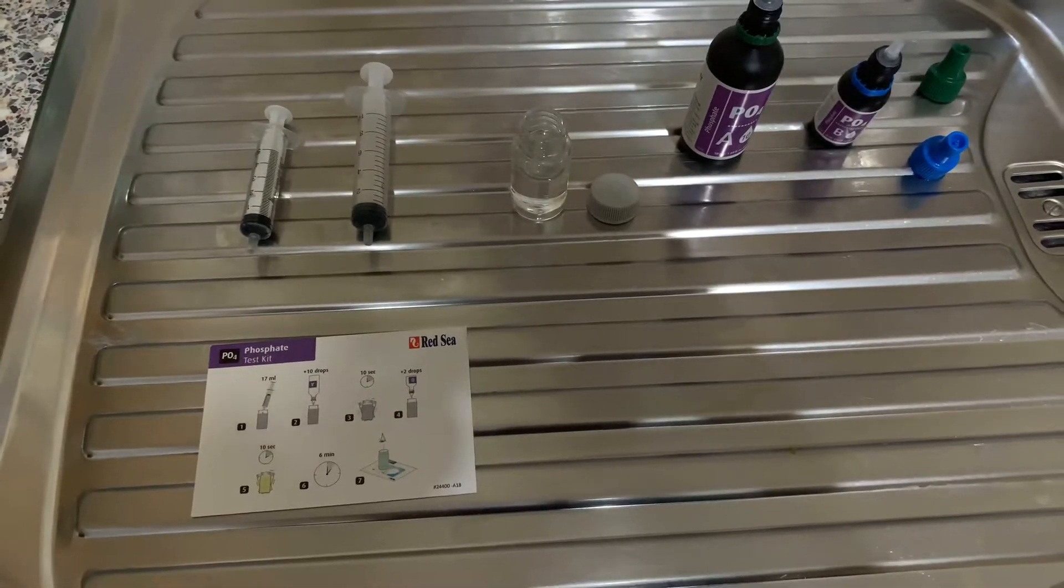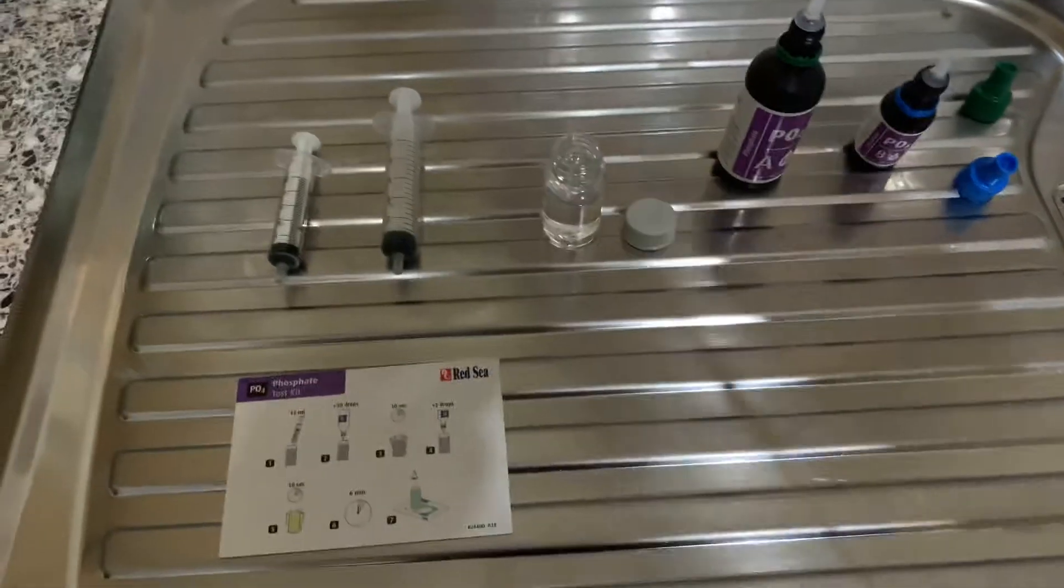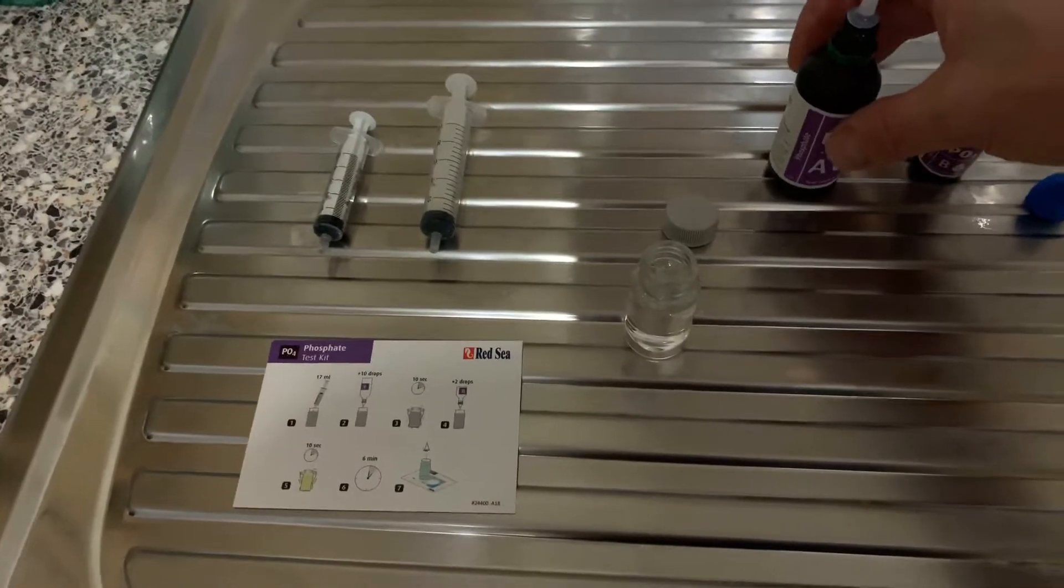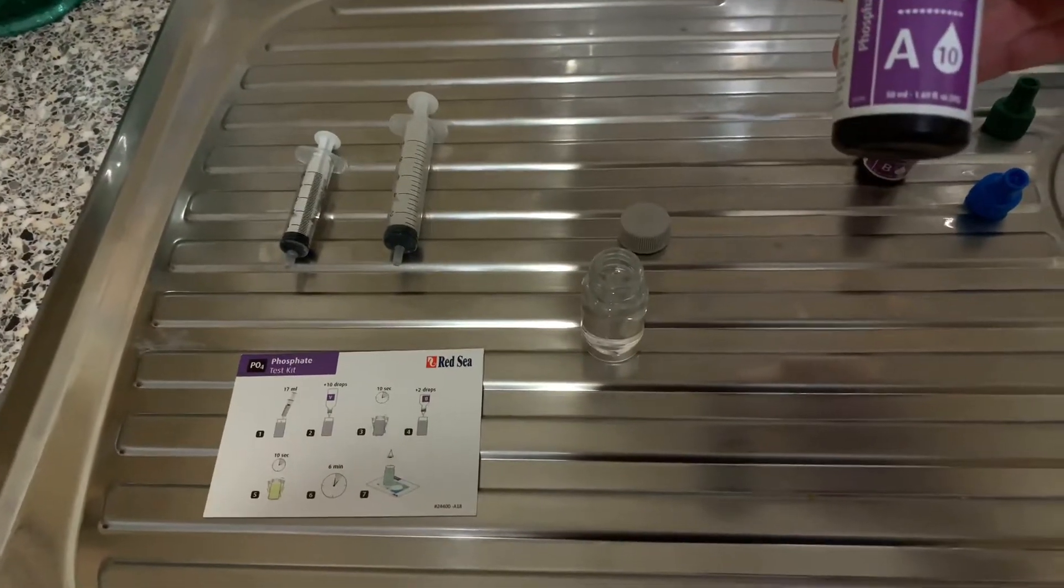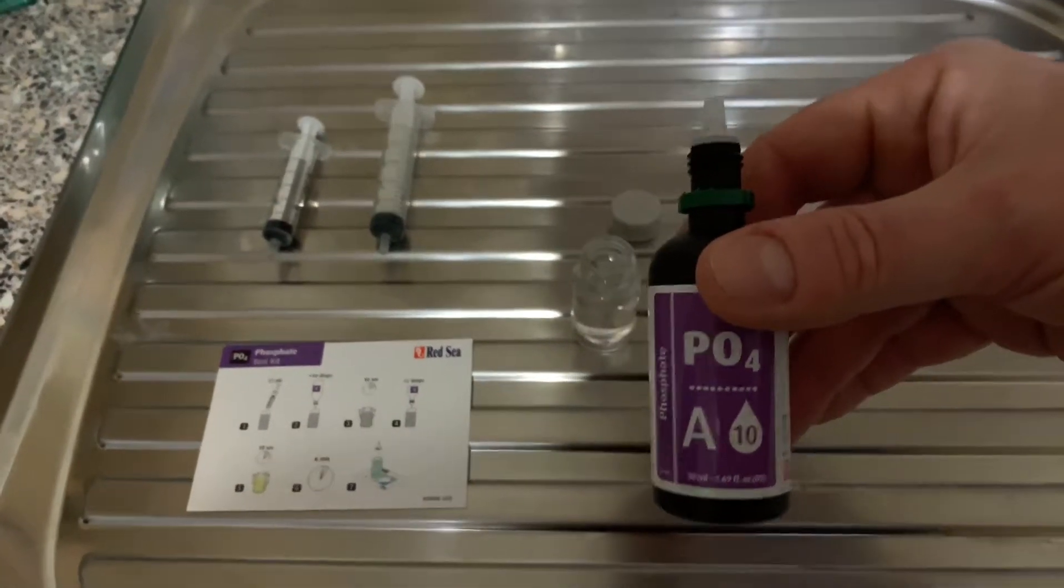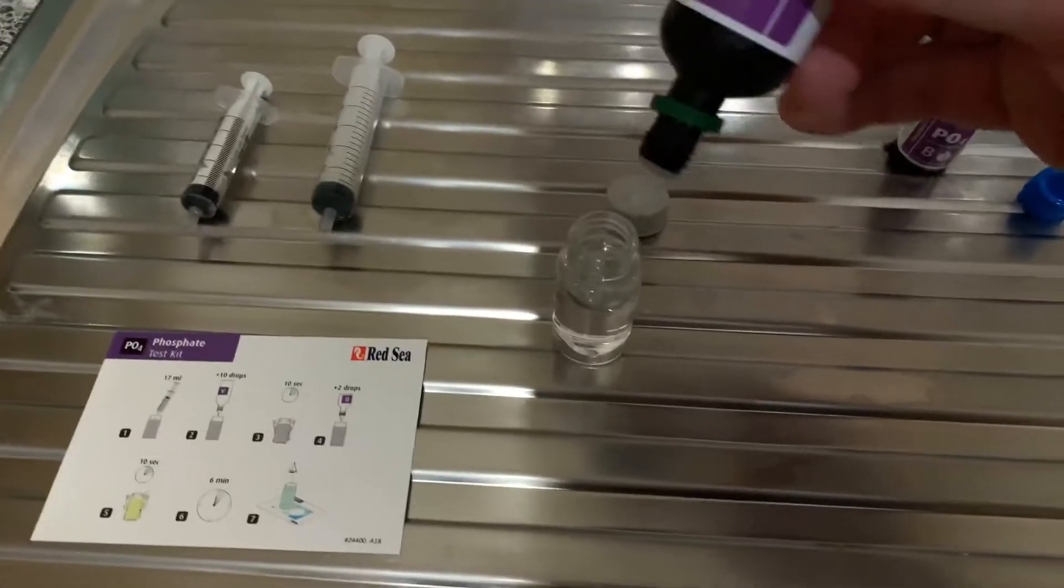First off you need 17ml of tank water in this vial. Then we've got 10 drops of Reagent A. So we'll just get 10 drops in.